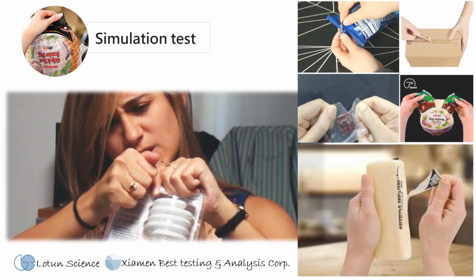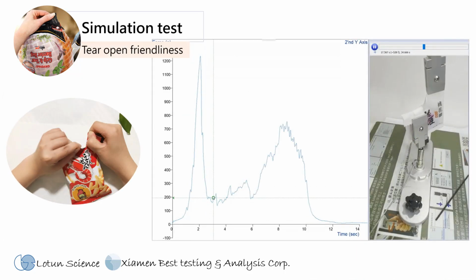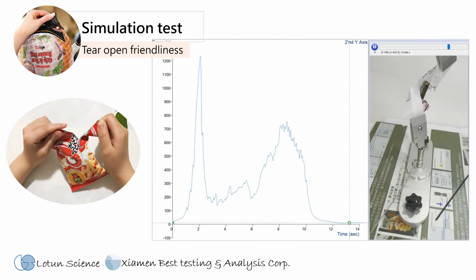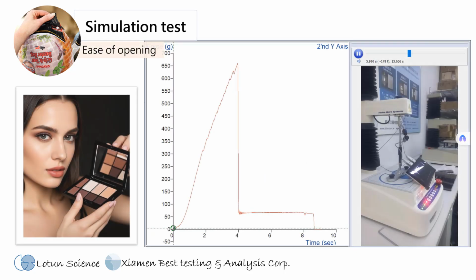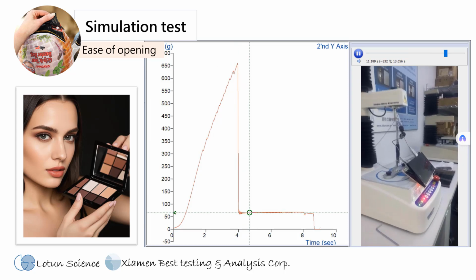Opening packaging is a daily action, but packages vary in type and shape, making it hard to use a single evaluation method. That's why simulating real-life actions is so important. We can use hinge-type fixtures to simulate how user-friendly a package is to open in daily life. Similarly, the ease of opening a cosmetic lid greatly affects user experience.